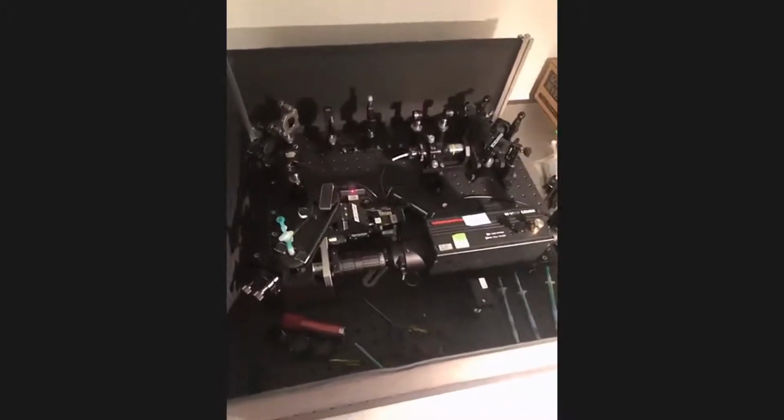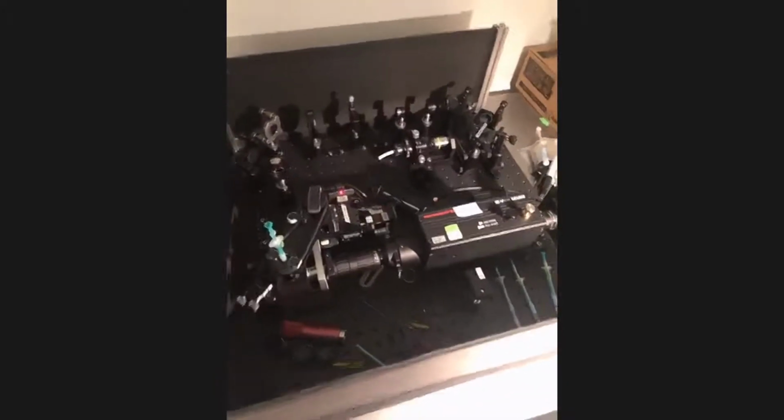and it indeed was actually built by an undergraduate student who worked with the director of this facility, Dr. Bentalila. The reason for that is that at the time, you couldn't buy this microscope. There was not a commercial producer of light sheet microscopes, and so we built them. So we build microscopes when we can't buy them, and then we commercialize them and work with our industrial partners to make these advanced technologies into something that's more generally accessible for the community.